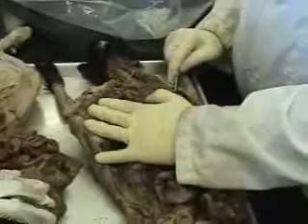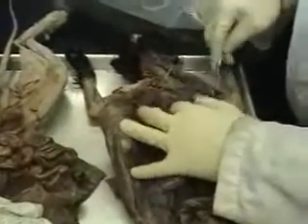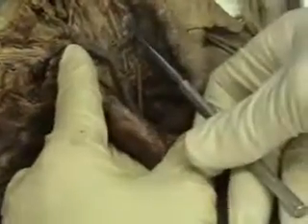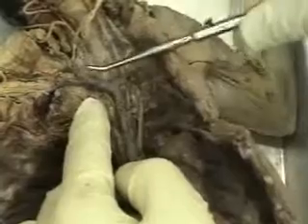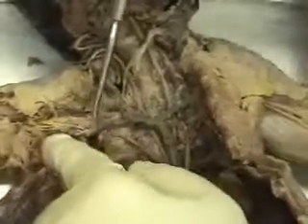All right. I'm going to review the arteries and veins in the chest area very briefly. So let's start with the veins, since that's most apparent. This is the heart. This large vein right here is the superior vena cava. The superior vena cava is formed by the confluence or joining together of a right and a left brachiocephalic vein. Brachiocephalic, of course, means arm-head vein. So each brachiocephalic is in turn formed by the joining together of a jugular vein, bringing blood down from the head, and a subclavian vein, bringing blood from the arm. So you can see the subclavian vein and the jugular vein joining together to form this right brachiocephalic vein. This is the left brachiocephalic vein, and the same thing's going on this side.